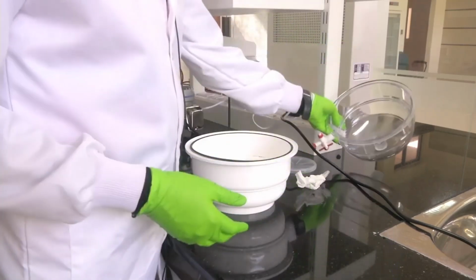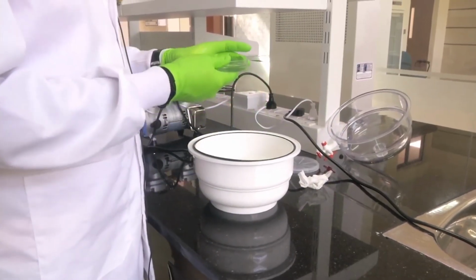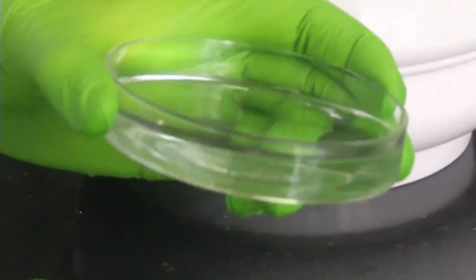Now we will see how clear the liquid has become. We are taking it out. Now see, it is very clear now. It's a very clear liquid. You cannot even see whether the liquid is there inside. That it is that clear.